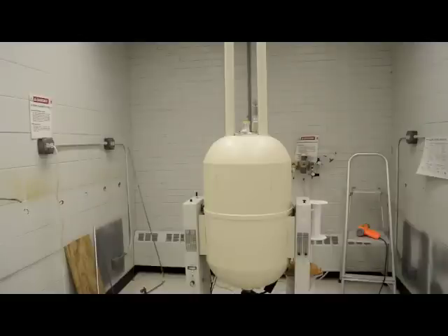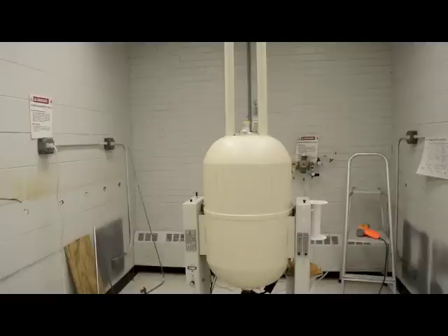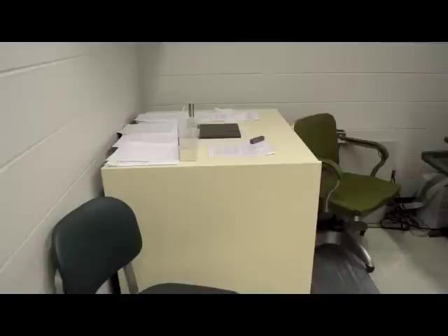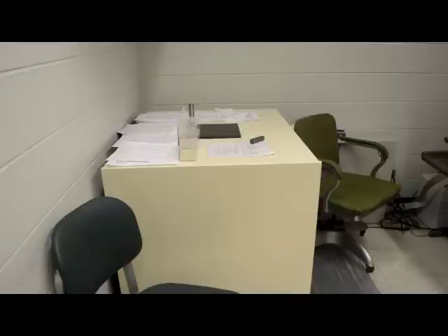This is the magnet container for our higher field instrument, the 300 MHz NMR. This instrument contains liquid helium to create the conditions necessary for superconductivity. Please do not bump into the instrument. This is the 90 MHz NMR. It has a permanent magnet and therefore does not need cryogenic liquids.